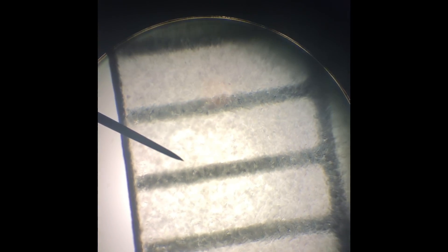What you want to do is count the number of millimeter lines in your field of view, and that will give you a measurement. On this one, there's one, two, three — just a little bit over four millimeter lines. You can see it a little bit better on the photo, which I'll show you now.